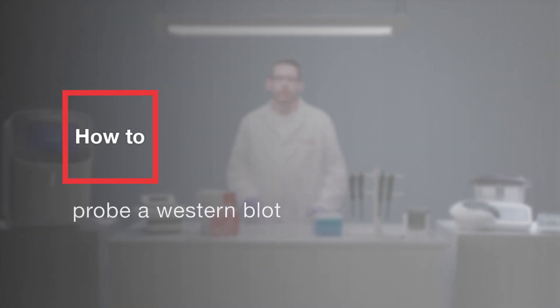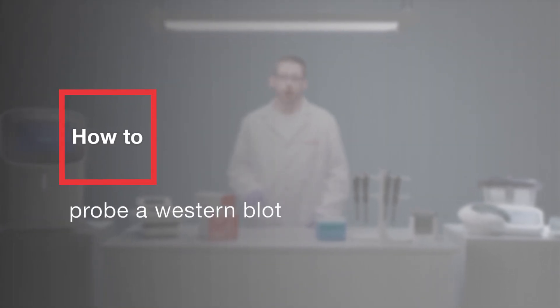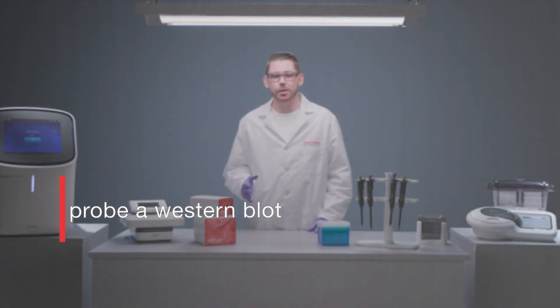After Western blot transfer, the membrane is ready to be probed for your target protein of interest, or the antigen.